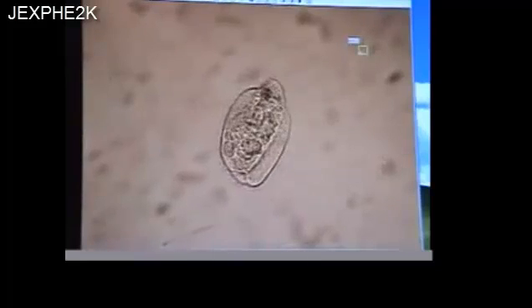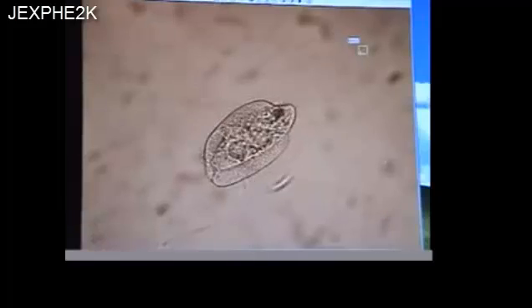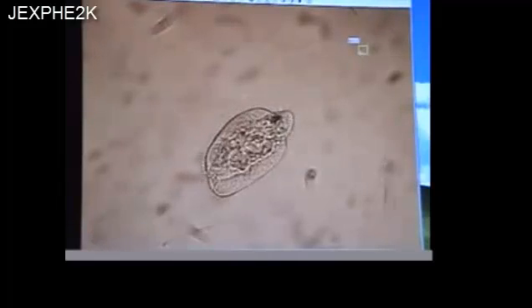Continued changes. Morphological transformation of the protozoa Paramecium caudatum. I will try to center the slide. There he is. Okay. As their shape changes, they sort of get pushed around on the slide a little bit.